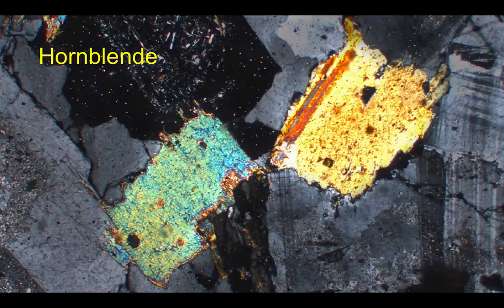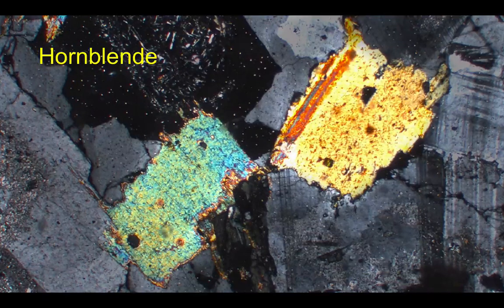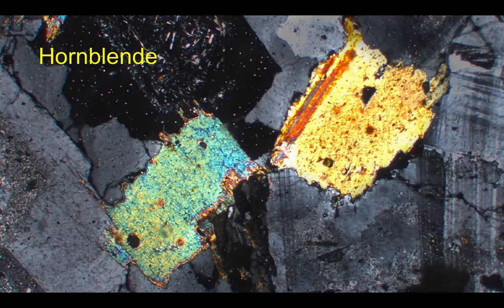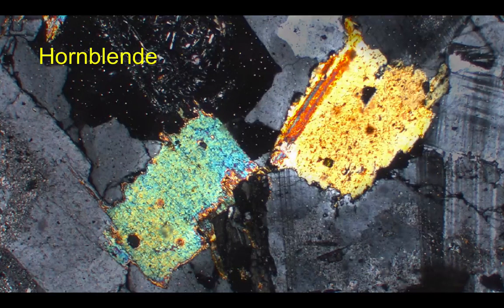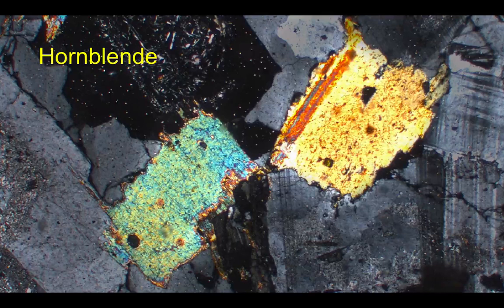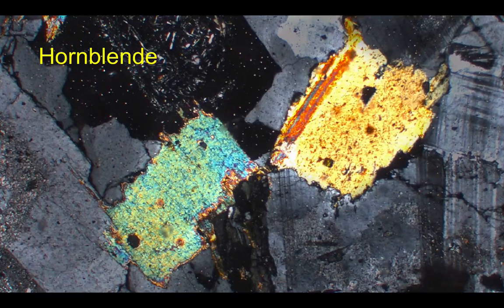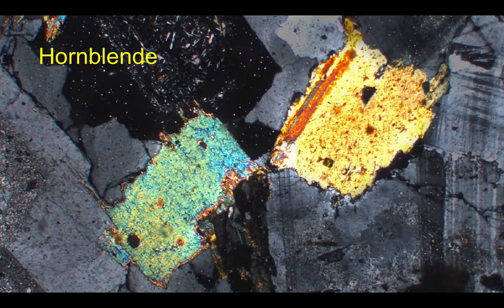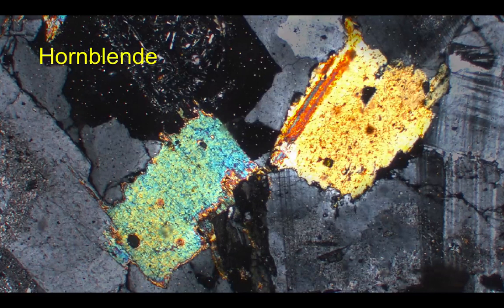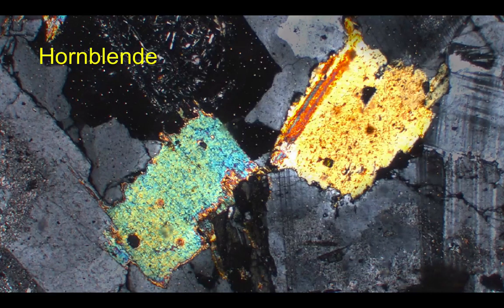Hornblende also varies in colour a little. This particular one, again taken from a granite from Donegal in Ireland, does have some similarities in appearance to augite. We get that pale brown orangey colour, you can see on the right-hand side. But we also see a range of pale green shades, like the crystal more on the left-hand side of the screen. As in hand specimen, augite and hornblende are distinguished by their cleavage. Unfortunately, neither of these views shows us cleavage in these crystals.